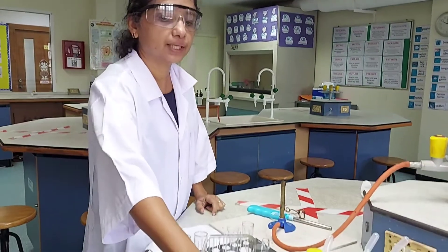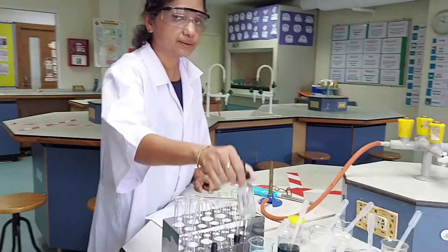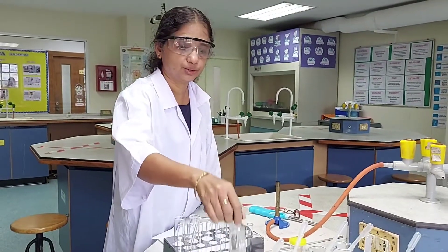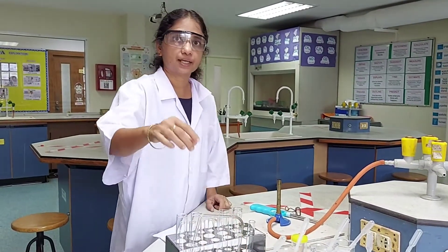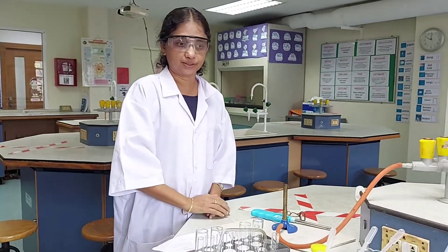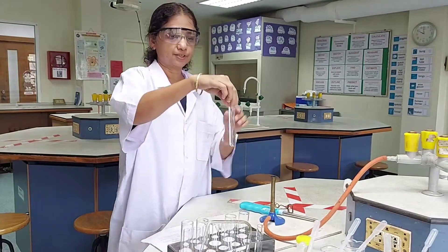Good morning. Today we will be doing the testing for cations, in which we will use two reagents — sodium hydroxide and ammonium hydroxide solutions — to test the metal ions present in the given solutions.